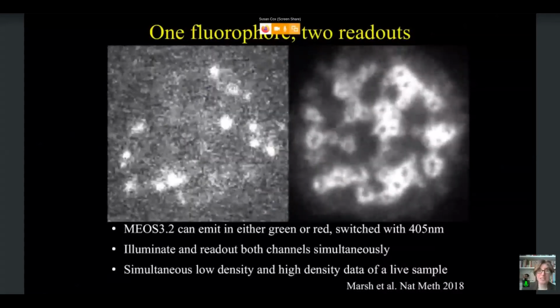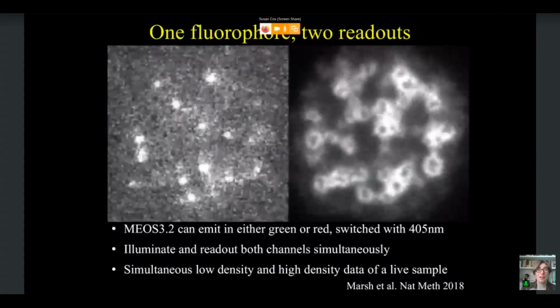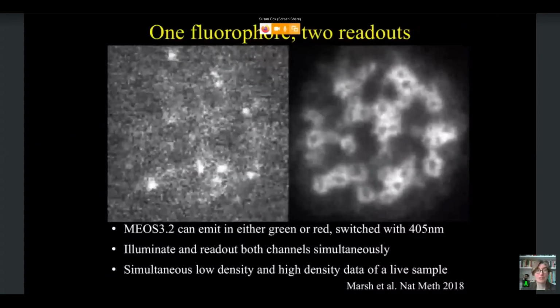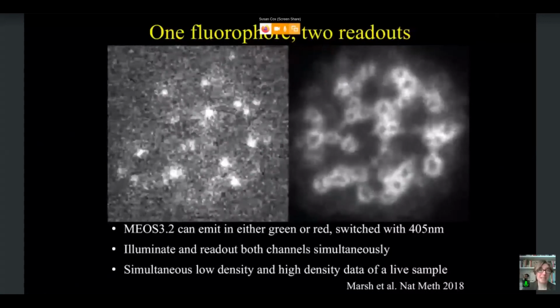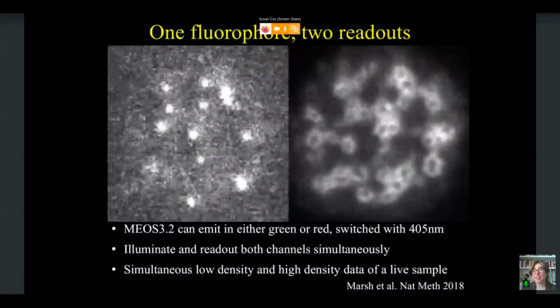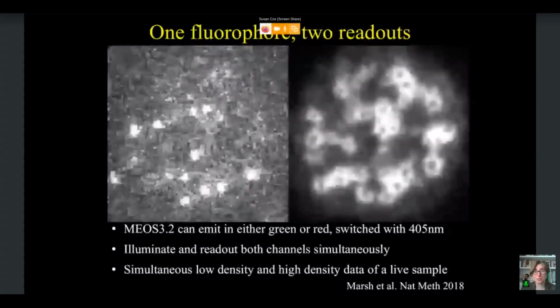So this is a partial talin construct. We know what the structure should be. It should be a ring structure. It's in podosomes. And we can see that we're getting low density data pretty nicely on the left, and then very high density on the right. You can see that we're not really seeing any individual fluorophores on the right-hand side.